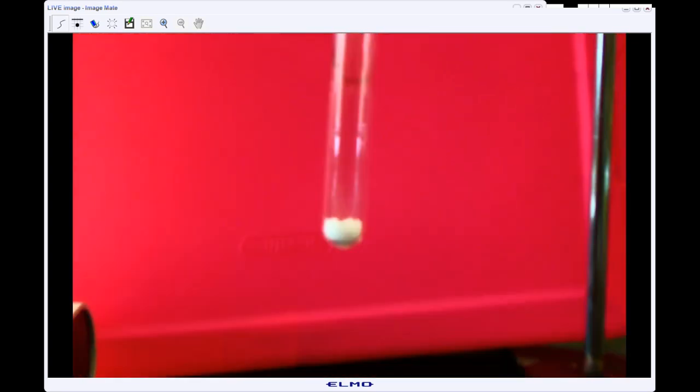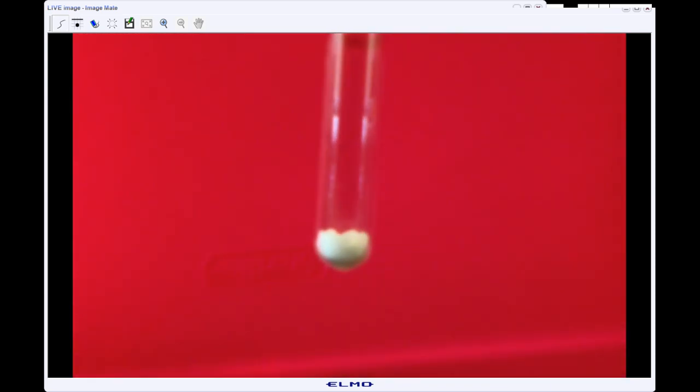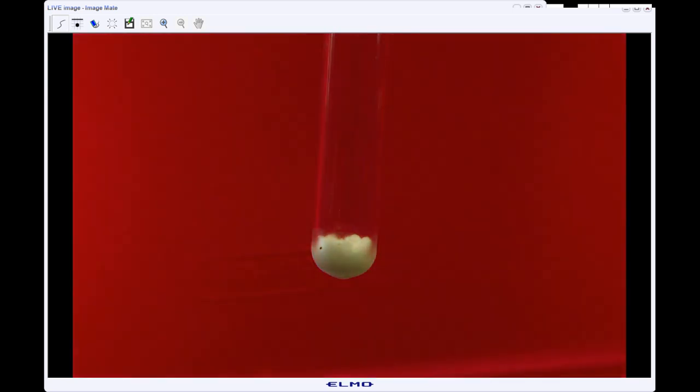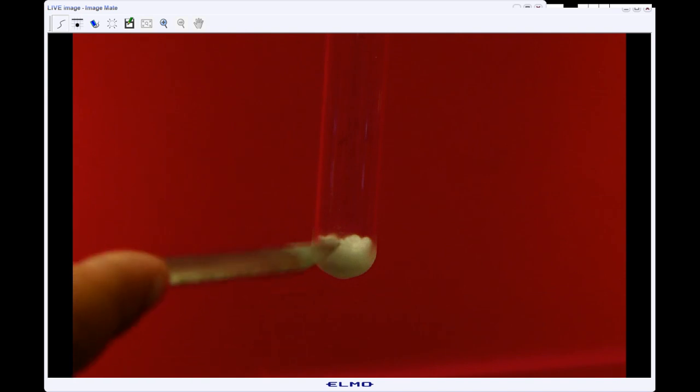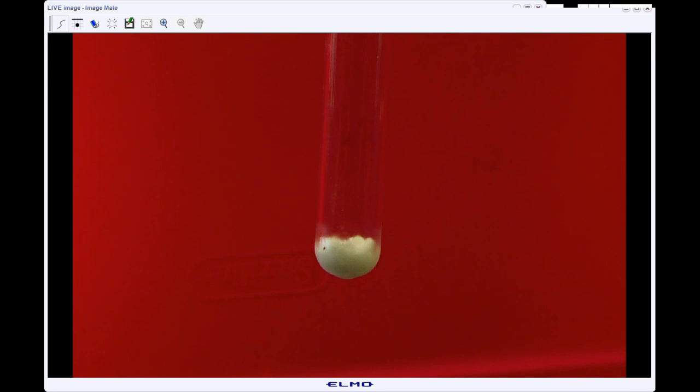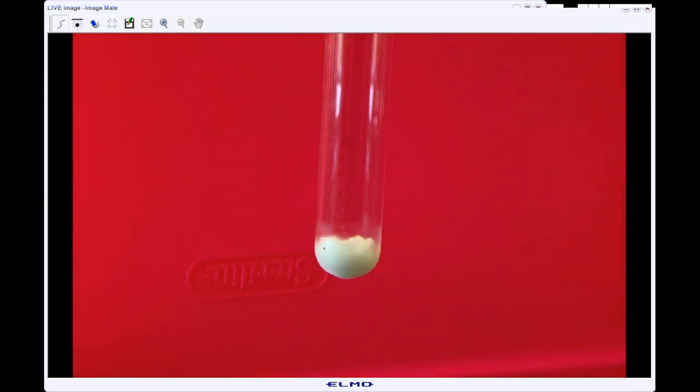So we're going to focus on that. All right, and we can see that it is a white solid, and that we're getting some condensation at the bottom of the test tube here. But other than that, we don't see much happening.